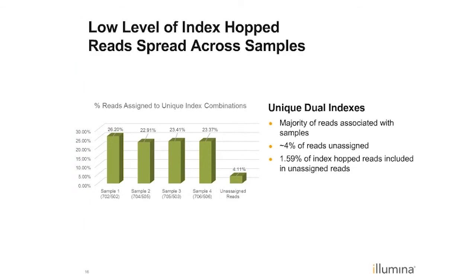And so another way to look at it is like this. If you ran this experiment using unique dual indexes, you would get 26, 22, 23, 23% of the libraries assigned to your 4 samples very cleanly without any potential contamination at all. And you would get a pile of 4% that are unassigned reads. Most of this pile is actually due to normal demultiplexing errors in the demultiplexing read or other things that happen during demultiplexing, where we would filter them out. And about 1.6% of this pile would represent the index hopped reads.